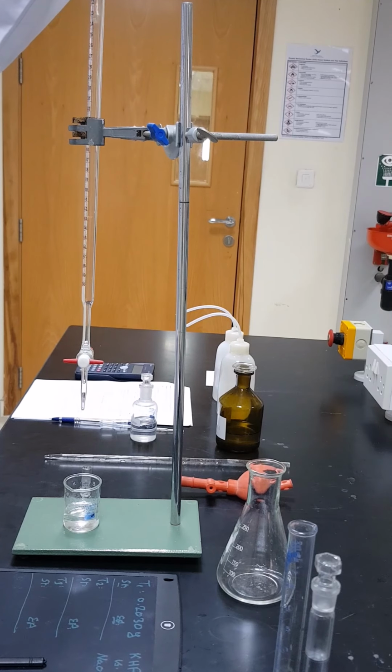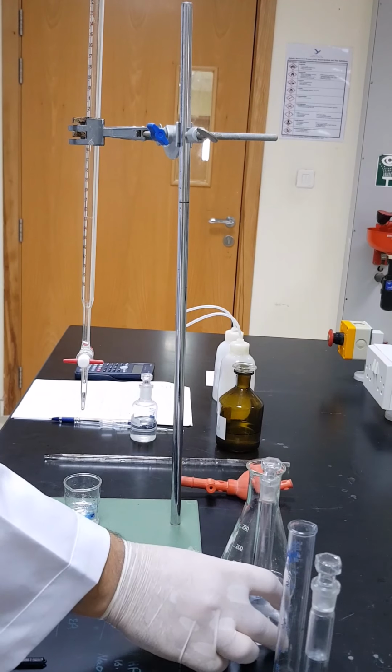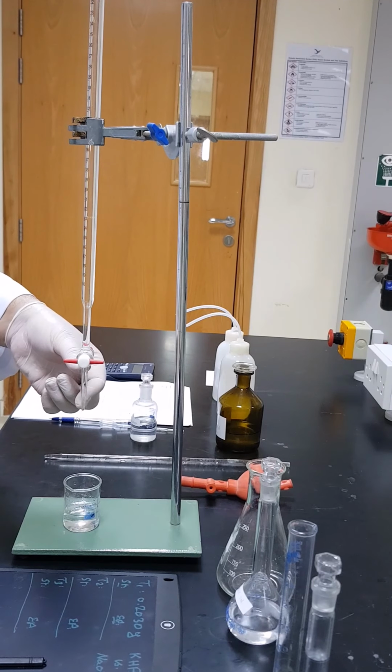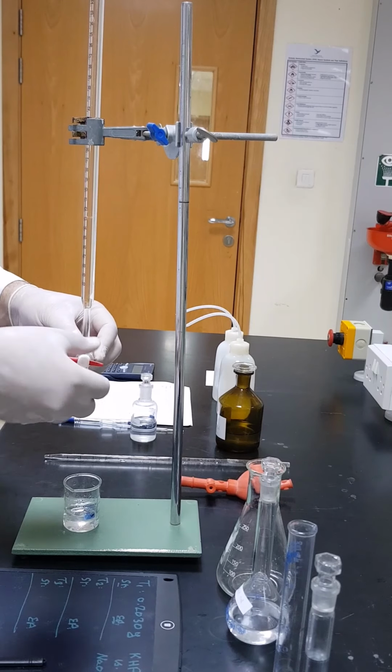solution. We have to do it very carefully to make sure that the burette is not overloaded, and we have to make sure as well that the funnel does not contain a huge amount of solution, so we will use the control later on. Now, first step, I have to make sure that the lower part of the burette after the valve is filled with the solution. So now it is filled.